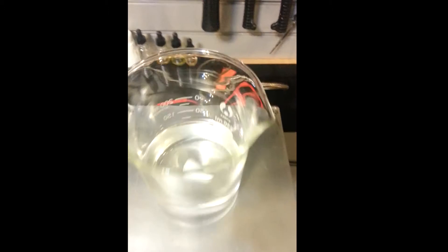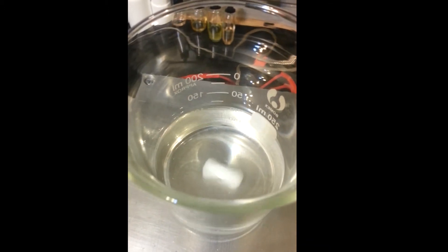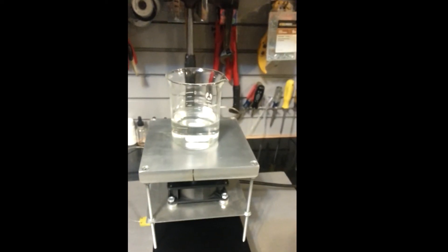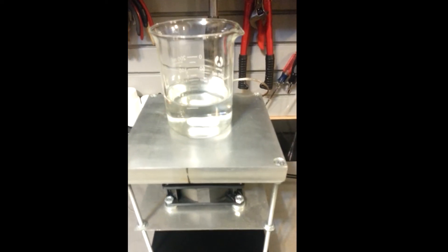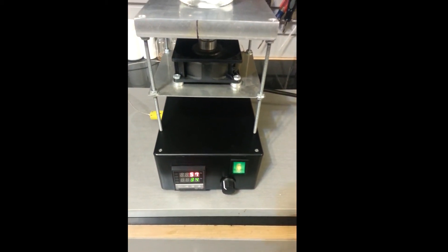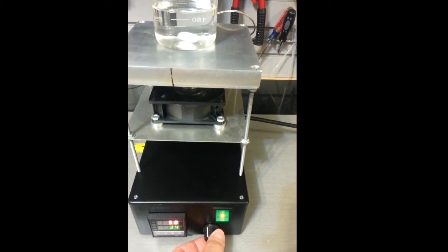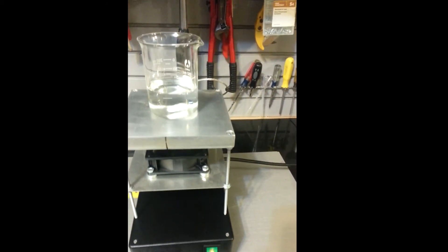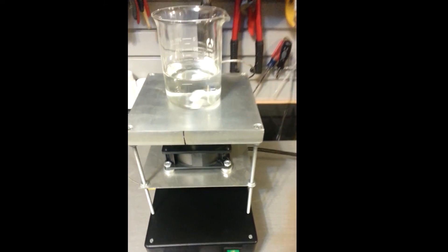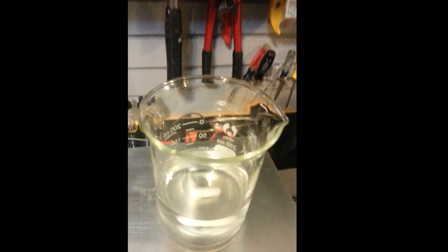As you can see, nice and slow. Or you can kick it up. Of course this thing can way overshoot the speed and often decouple the magnet. But it's a really accurate system — I've left it on overnight just to test it and make sure it works okay. The pulse width modulator is great, very accurate. It maintained what looked to be the same speed overnight with no ill effects whatsoever.